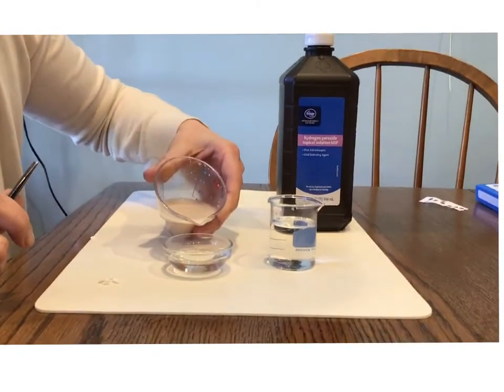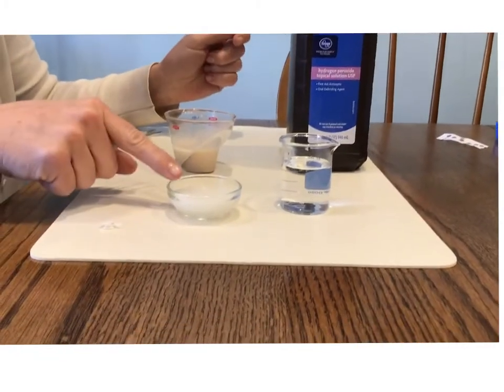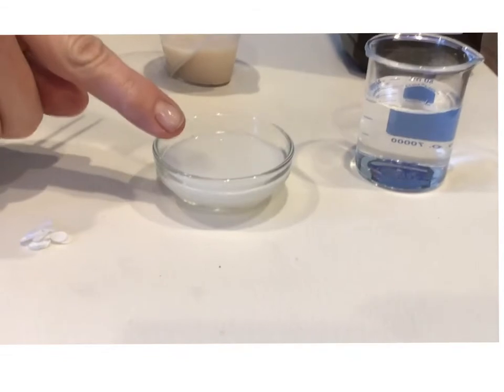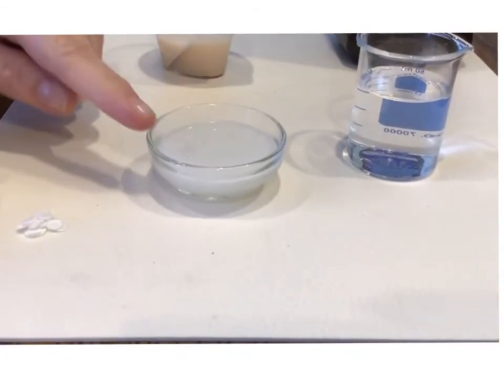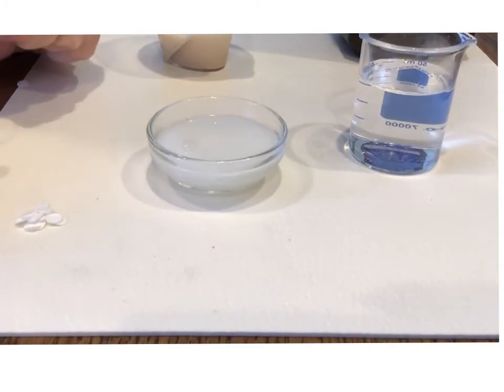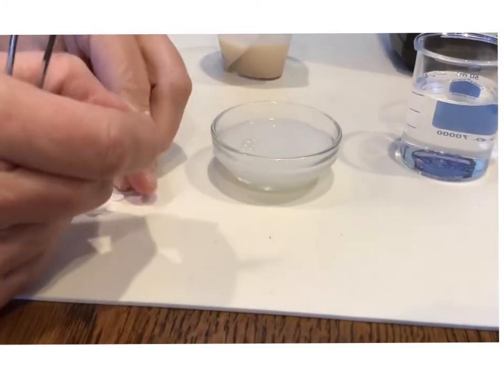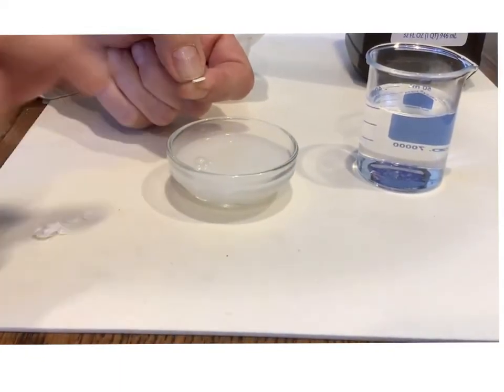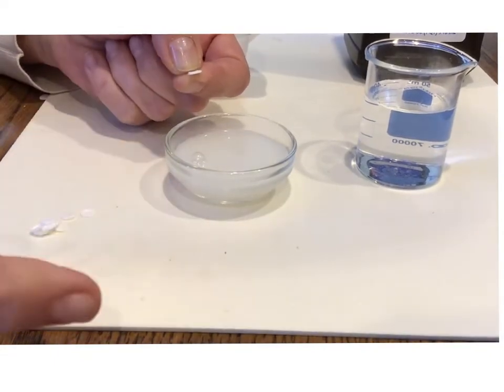So I'm going to pour this in so that you can see what happens, and you can see that it becomes all bubbly. Right, you can see the bubbles coming up. Now we're going to utilize this reaction with the bubbles to float a paper disc. So theoretically, if the paper disc is in there, the oxygen bubbles are going to attach to the paper disc and carry it to the top.